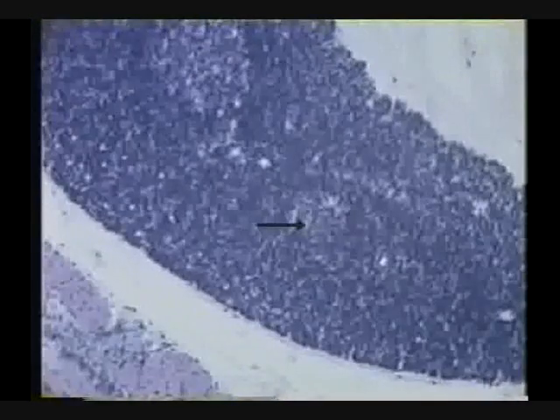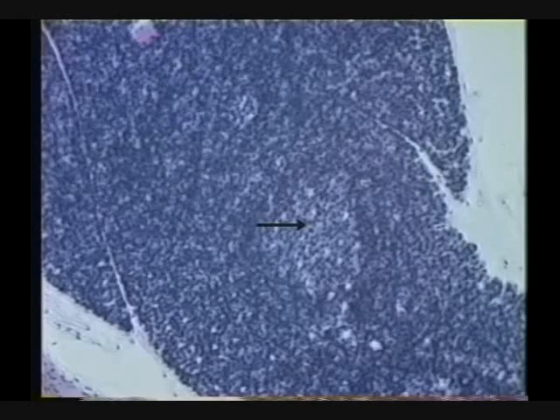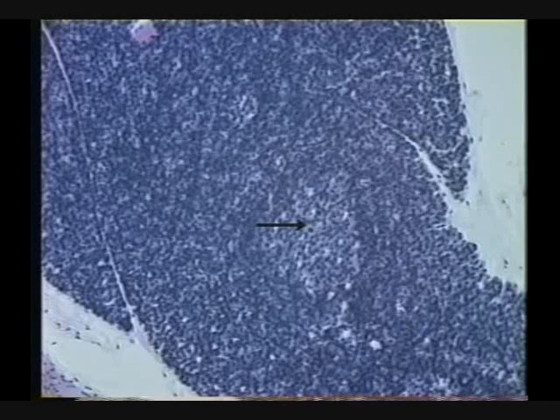Pancreas. Now you notice this little light area there? Well, here's a good one there. See the light area? That light area is what portion of the pancreas? Islet of Langerhans. Name two specific products of the islet of Langerhans. Insulin and glucagon. Okay? These are the two hormones that deal with your body's metabolic process, the way you're dealing with proteins, carbohydrates, and lipids.